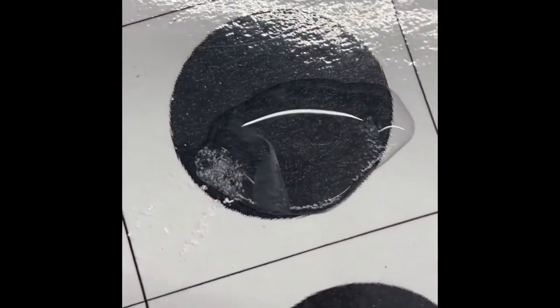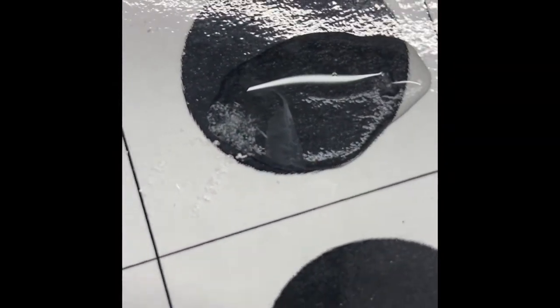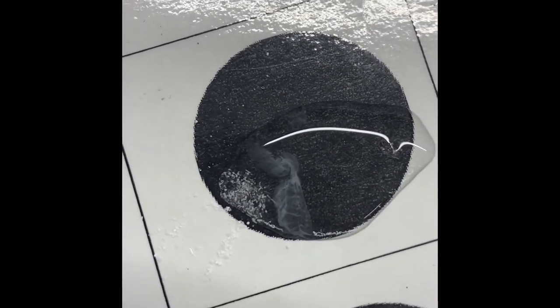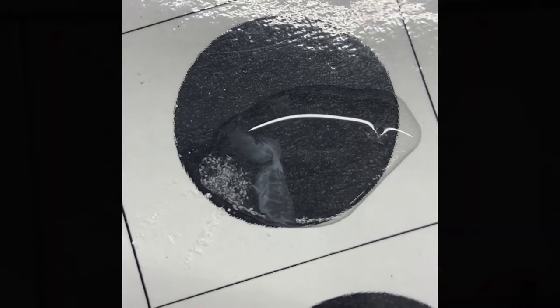Okay, this is definitely the group that deserves to be on the TikTok video. Over here, there is sodium carbonate put in the magnesium part, and there's something solid forming in the middle. Let's find out what it is. Inquiring minds want to know - can you guys balance that equation?